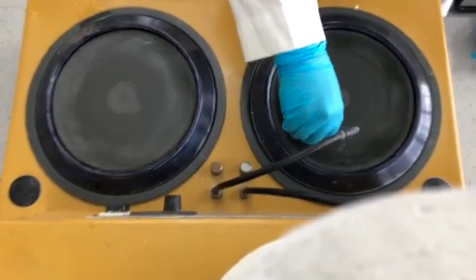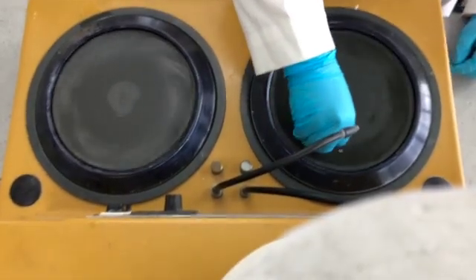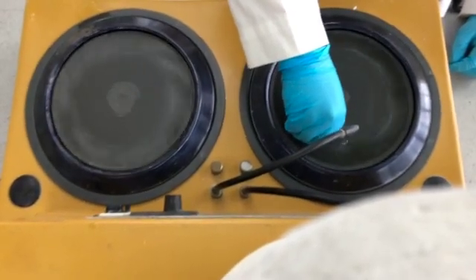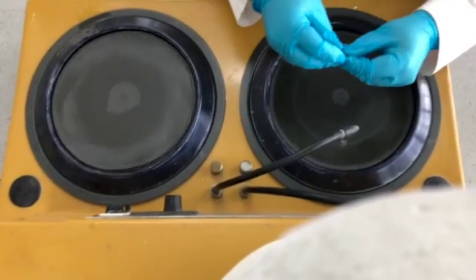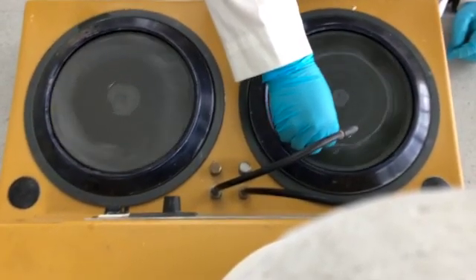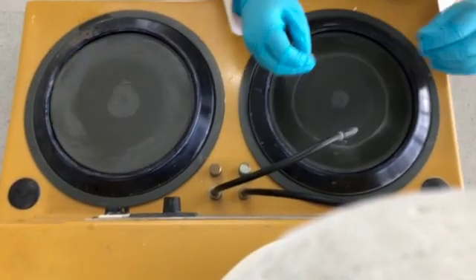With that you will see that there will be scores from the grinder found on the surface of the adhesive. Now if you were going to do microscopy that's not a big issue, but you will see striations. This also applies if you were going to do subsequent analysis with, for example, SEM EDX — scanning electron microscopy and energy dispersive x-ray.